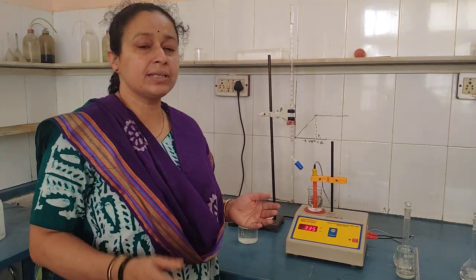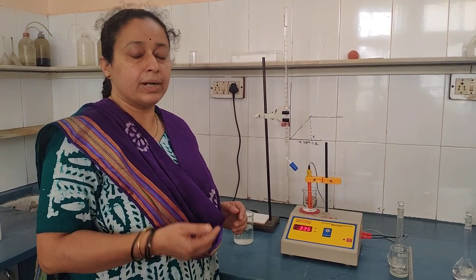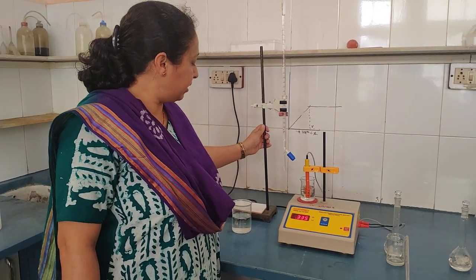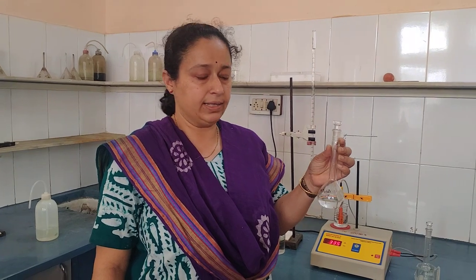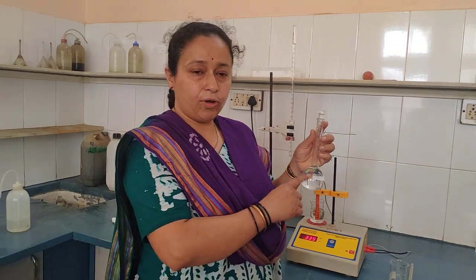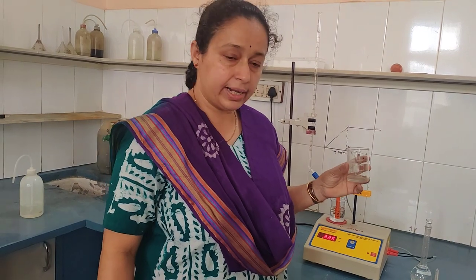Your experiment is a simple HCl–NaOH titration, which we are now going to carry out using the conductometer instead of a phenolphthalein indicator. You need to take the burette, wash it, rinse it, and fill it with NaOH. An unknown HCl solution is supplied to you in a 100 ml standard measuring flask — dilute it up to the mark with distilled water, then pipette out 10 ml of it into a beaker.